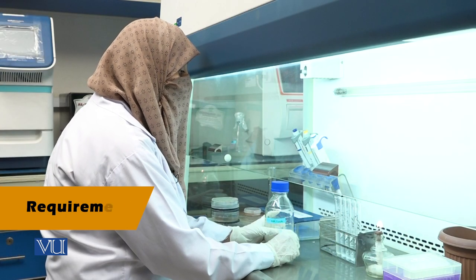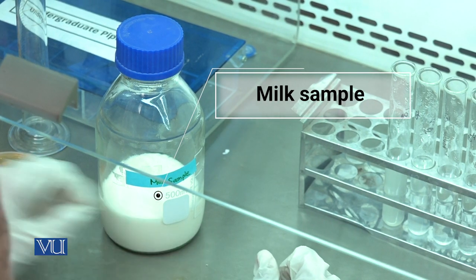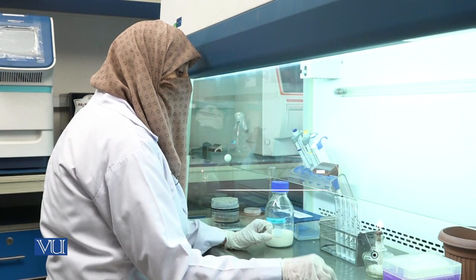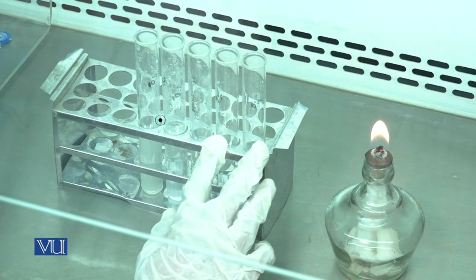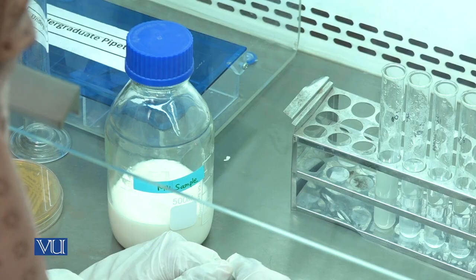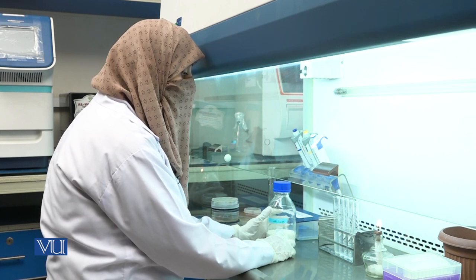The ingredients and materials required include: milk sample, inoculating loop, burner, and test tube containing sterile distilled water for serial dilution. Collect milk sample from cow and pasteurize at 85 degrees centigrade for 30 minutes.